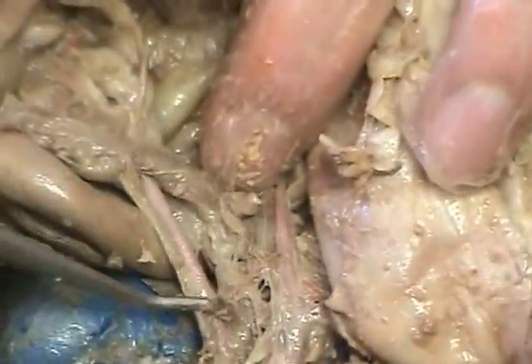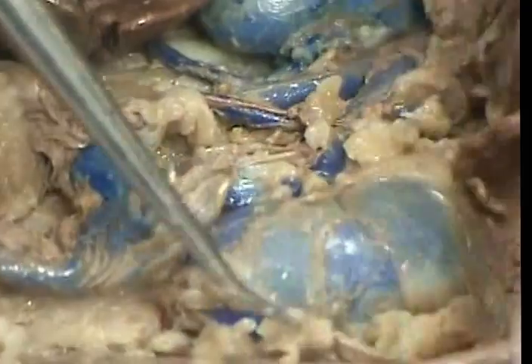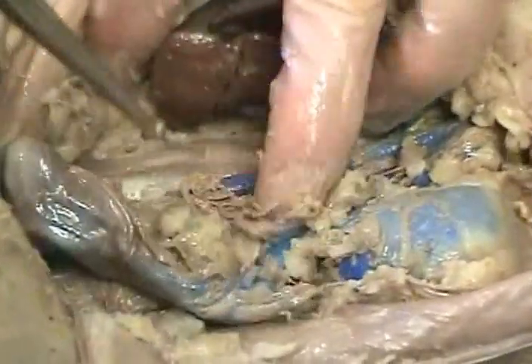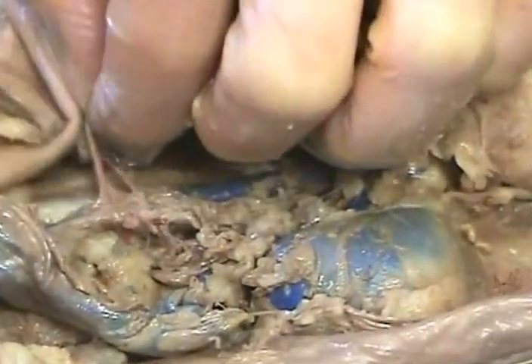This one is called cranial mesenteric. It goes to the intestines from the aorta. The one going to the kidney is the renal artery and vein. While we're over here looking down, this one that you guys cut is the caudal mesenteric. It would go over to the intestine right there.